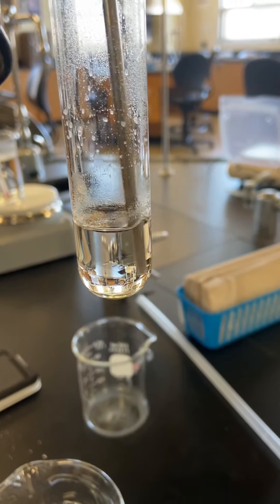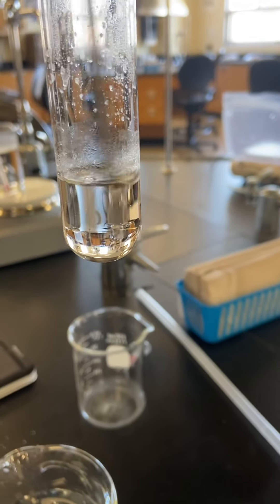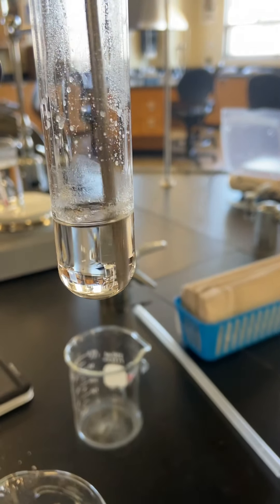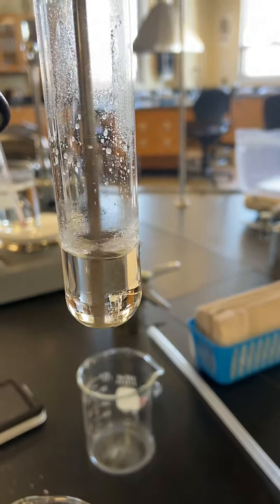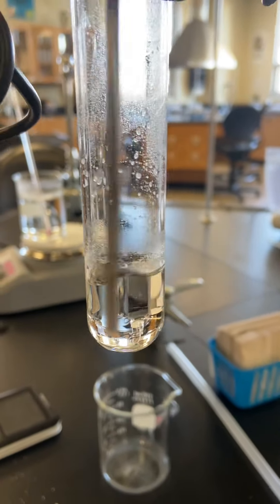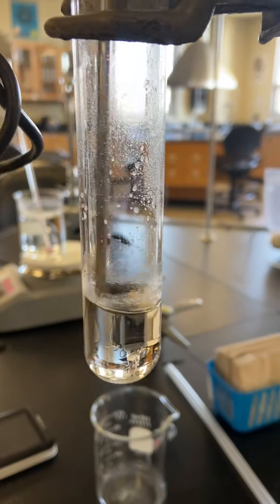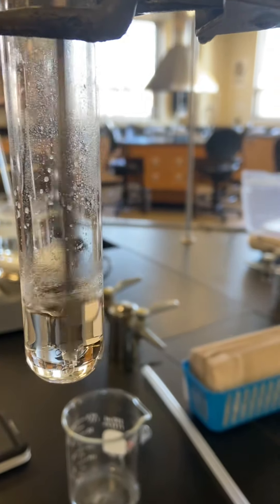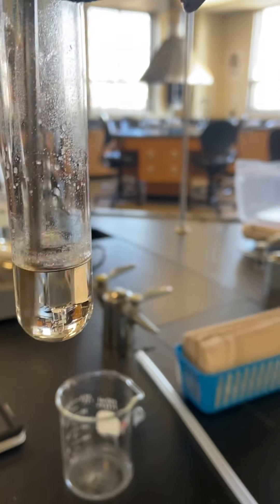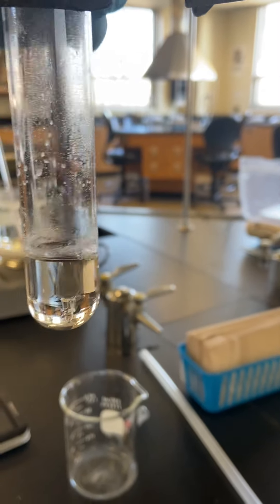That's cool, you can see it's turning. There's like little white specks in it. So according to the instructions, once it starts to freeze, we can submerse it in a beaker of cool water. So should we go ahead and lower it? Okay, fine.